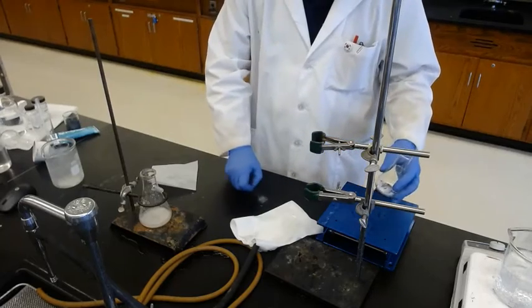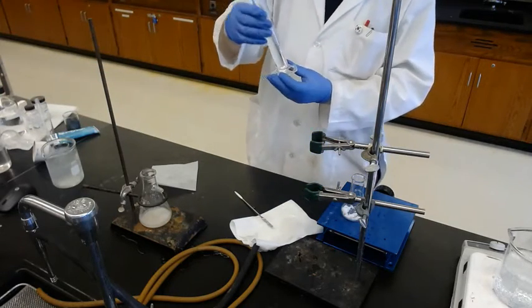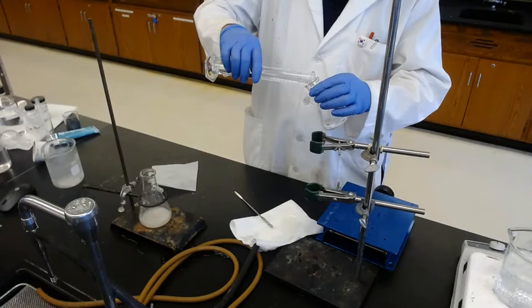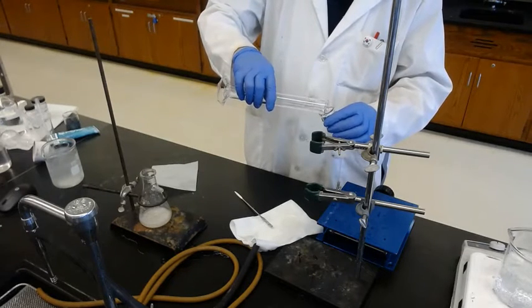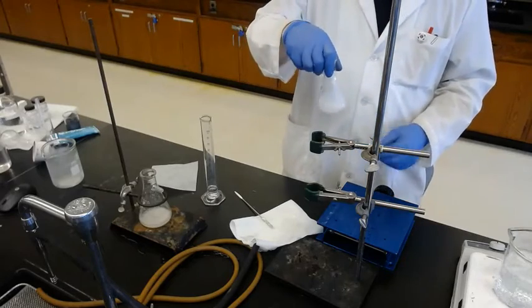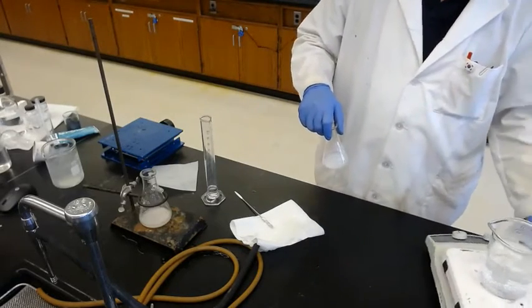Okay, and today the solvent is ethanol. So maybe we're using about 60 milliliters of ethanol, but since we have to make the saturated solution at high temperature, the boiling point of the solvent, we add about 50 first. So remaining about 10 from the 60. So about 50 milliliters of ethanol is added. Switch on. And our hot water is ready.